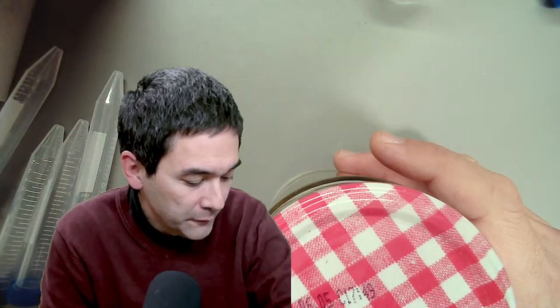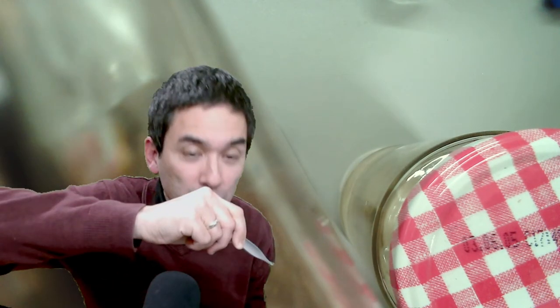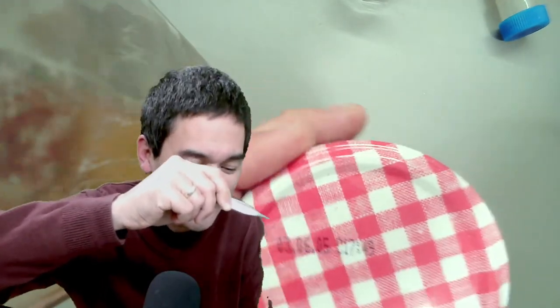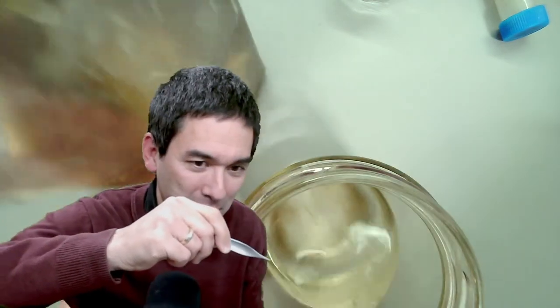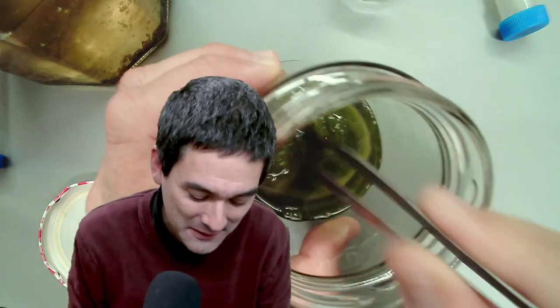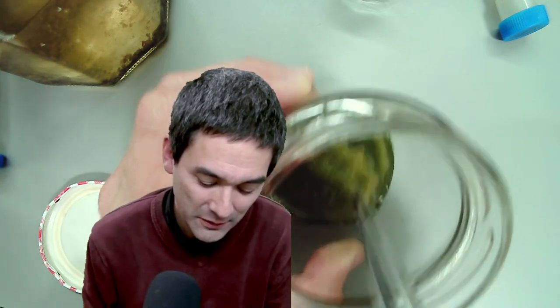I'll start with the coffee and the algae water sample. This algae sample is a little bit different — over here I have a jar with algae. I've simply taken some out — look, they're all green. Because of the green screen it appears transparent and invisible, but there are algae here. I'm going to rinse out whatever is in here and put it in the tube, and now you're able to see it.